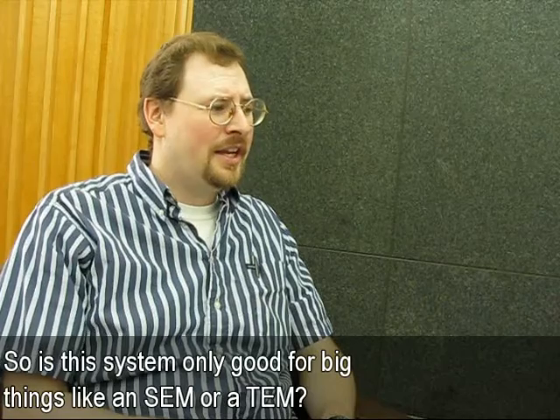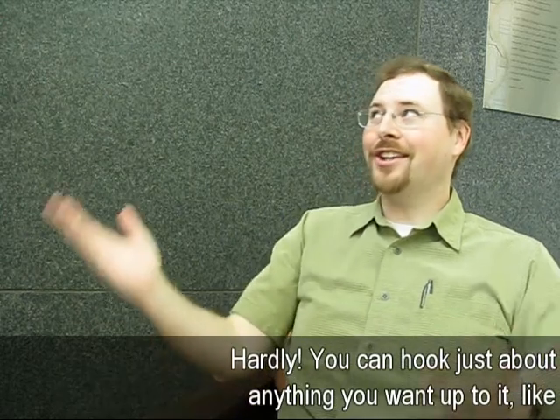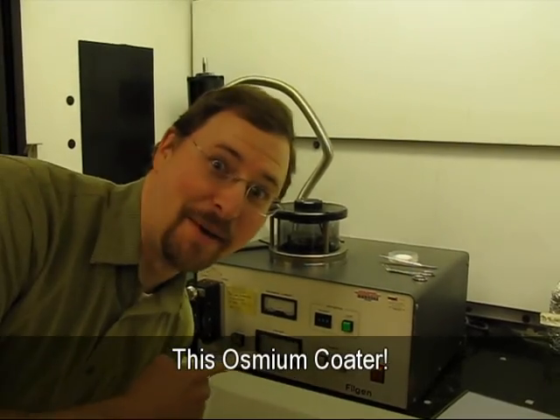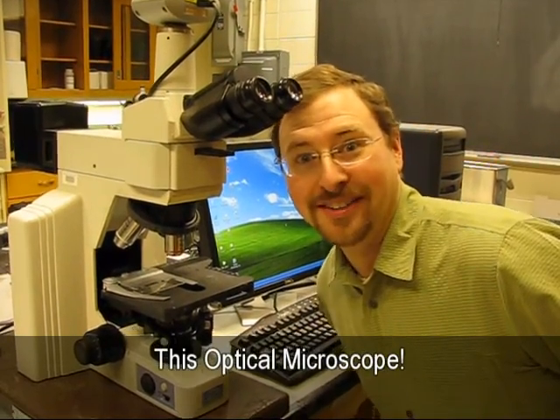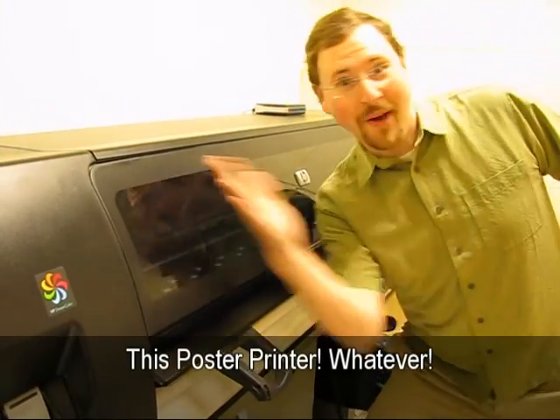Whatever you want. So is this system only good for big things like an SEM or a TEM? Hardly! You can hook just about anything you want up to it, like this osmium coater, this critical point dryer, this optical microscope, this stapler, oh wait a sec, this poster printer, whatever!